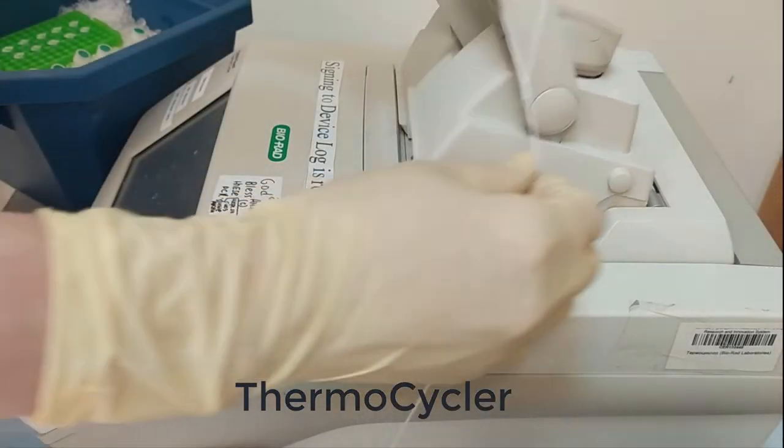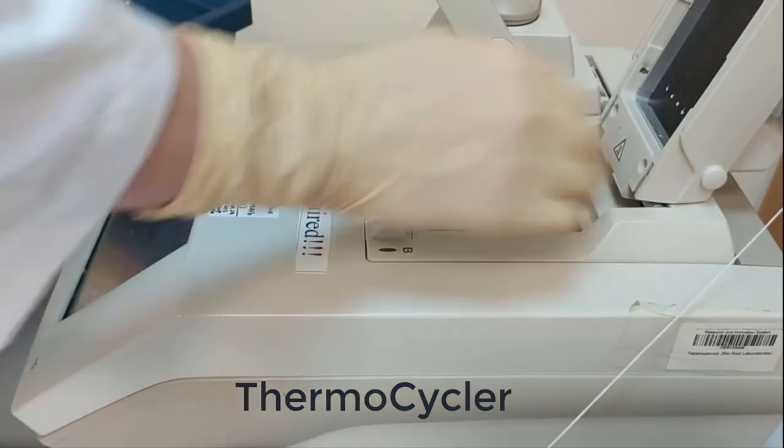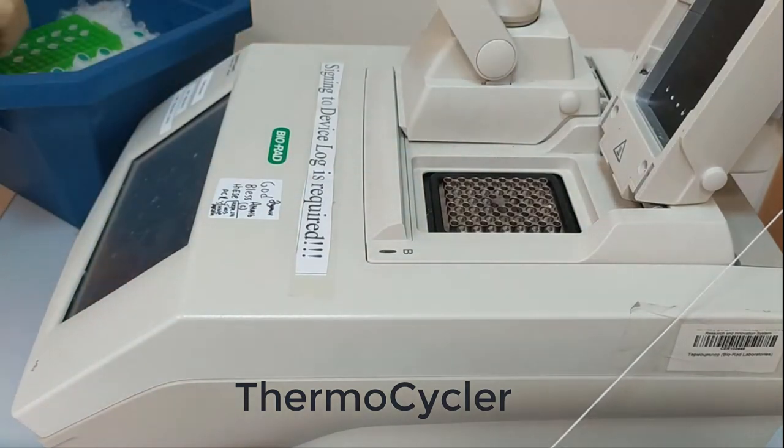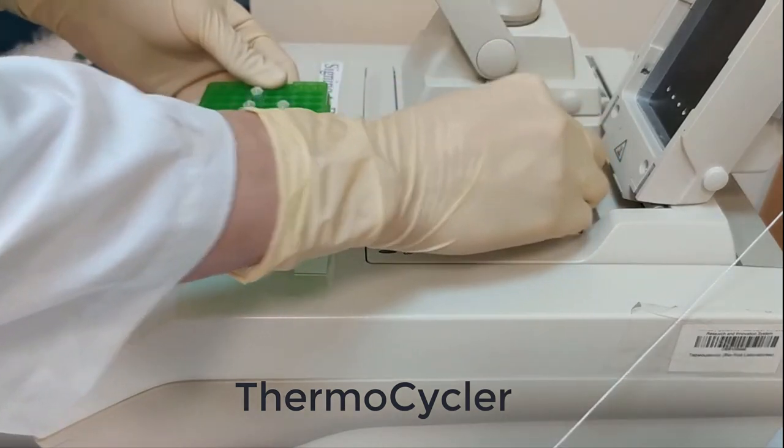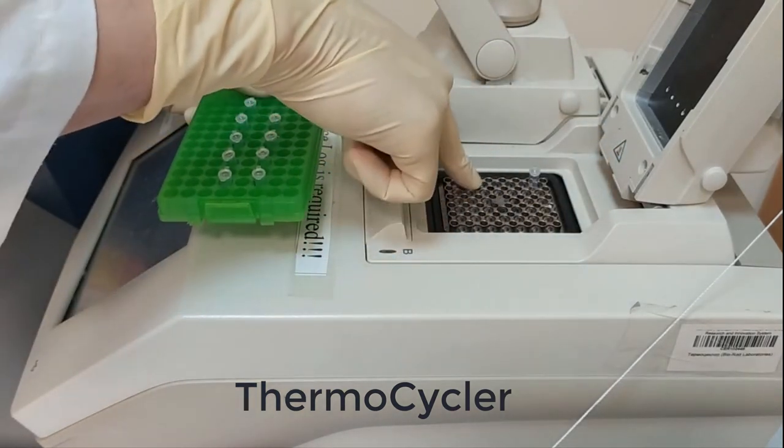Okay, so we are going to use one of the blocks. This is block B and we are going to transfer our samples and place them inside the block.